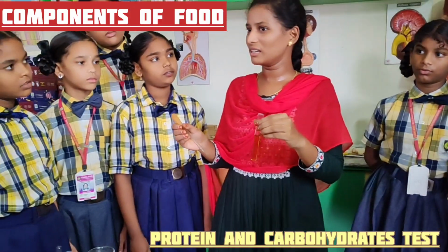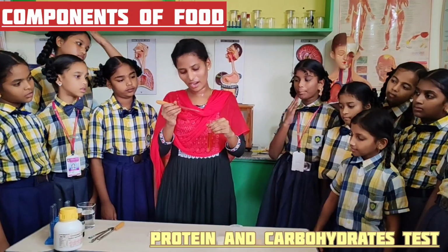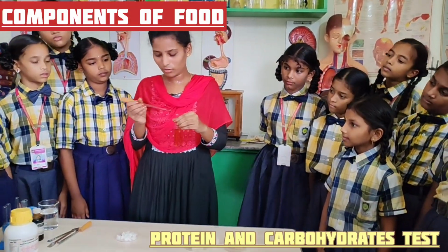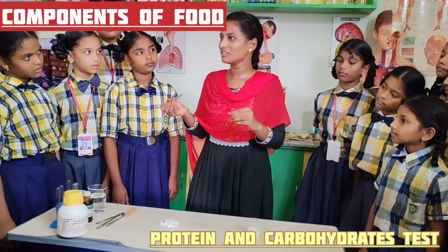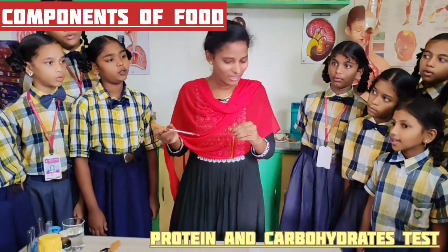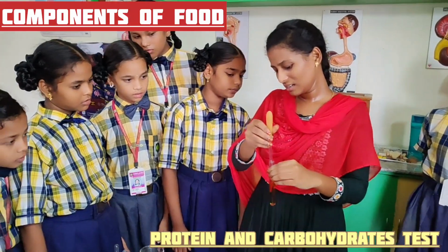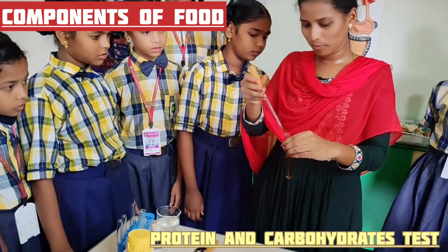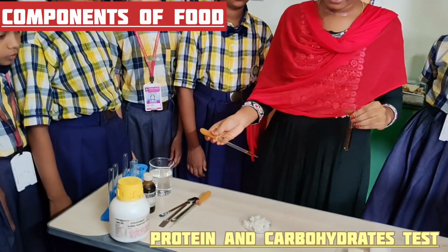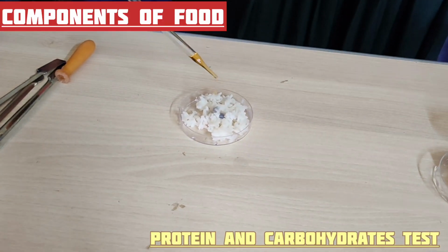If any food material contains carbohydrates in high amounts, when we pour a few drops of iodine solution on that food material, it turns into which color? Blue. Yes, very good. Blue black color. I am taking a few drops of iodine solution with the help of a dropper. And I am adding these drops of iodine solution into the rice.